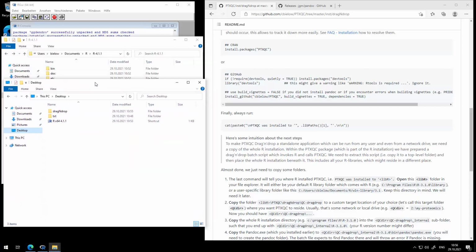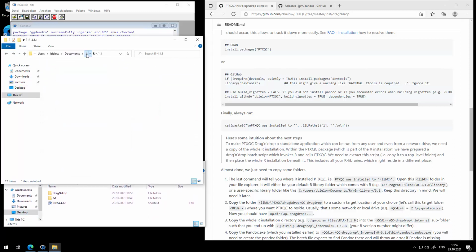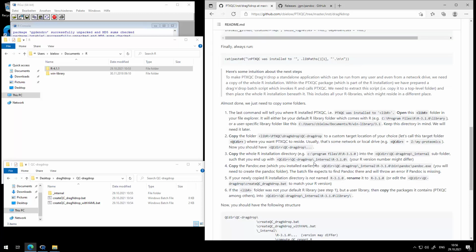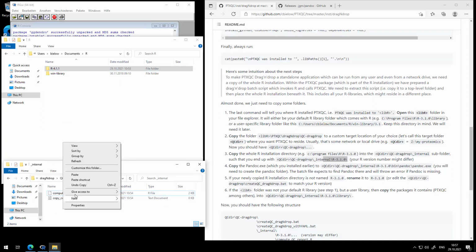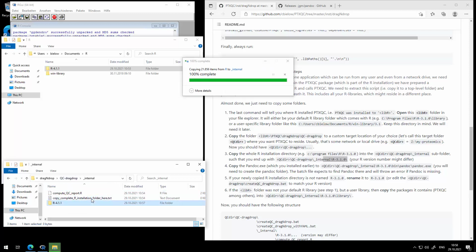We're going to copy R, so the whole R installation, into a subfolder of this drag and drop. So it's a little bit cat and mouse here. If you read the installation instructions, it tells you exactly what to do. So basically, we need the main folder of the R installation, copy it and paste it into the internal subfolder of our drag and drop feature, basically. I'm going to copy that. Okay, sweet.